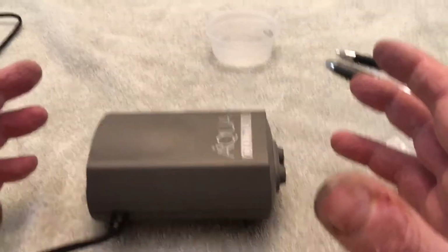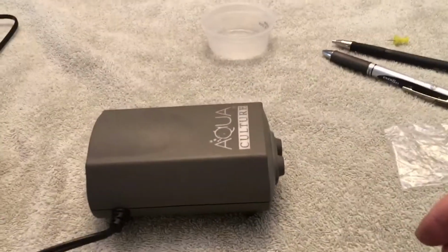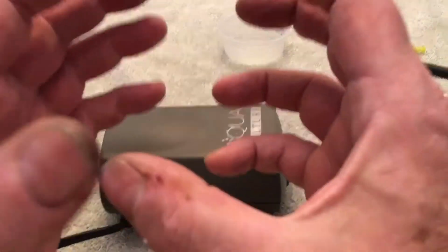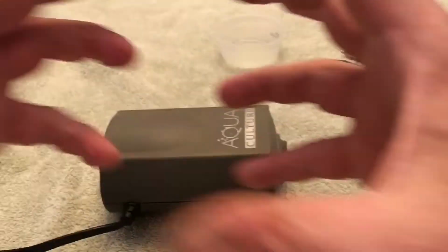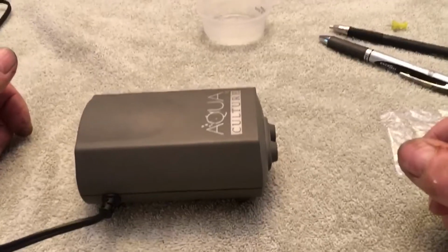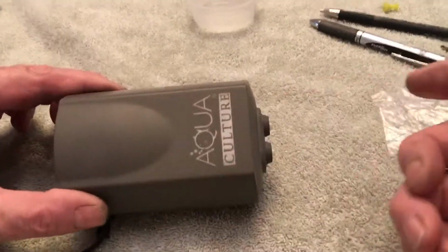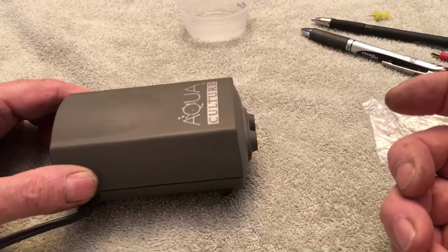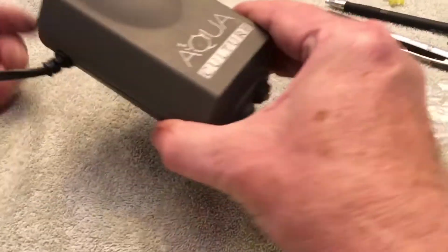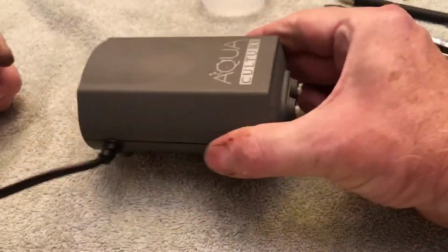Gases, air, oxygen, nitrogen are able to compress. If water goes in there, liquids do not compress. If you've ever taken a water balloon, you see what happens when you try to compress it. Air balloon you can squeeze, you can compress, but use this only for gases, not for liquids. And basically that's how you turn an aquarium pump from Walmart, the Aqua Culture, into a vacuum pump.